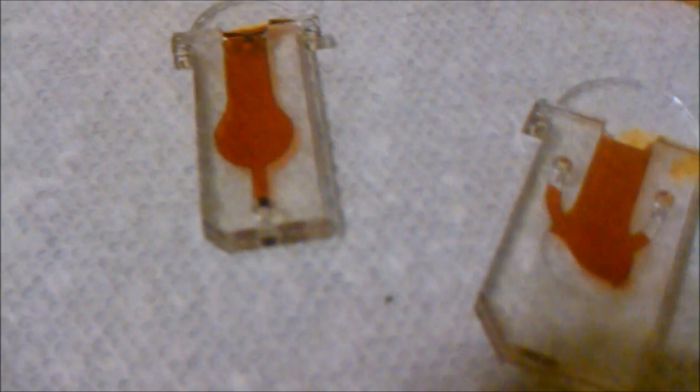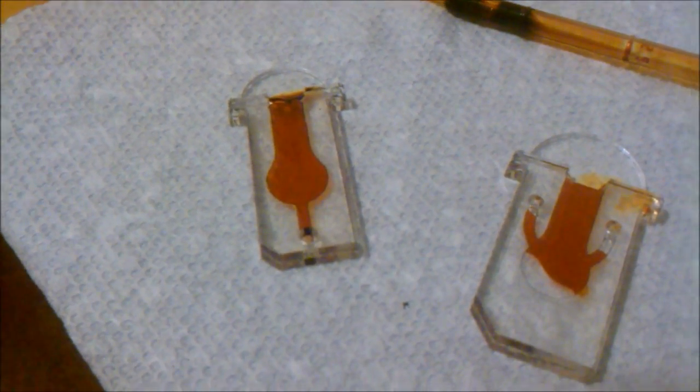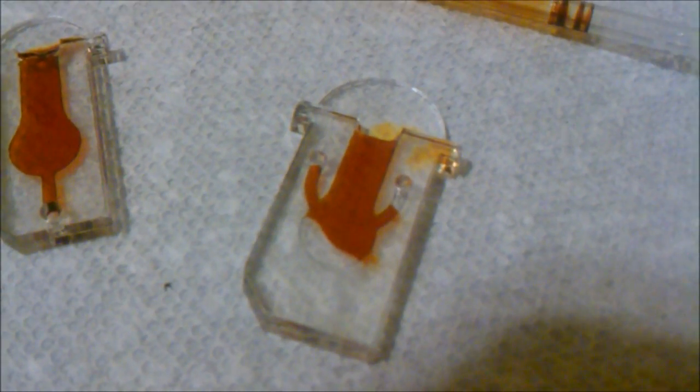We've got a little, let me turn off the light here. There's a little breather hole right at the end. And this one's got two. That was kind of just an experiment. I mean, they're all experimental, so.